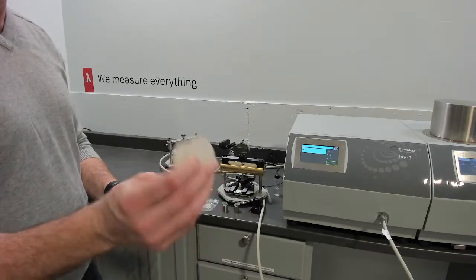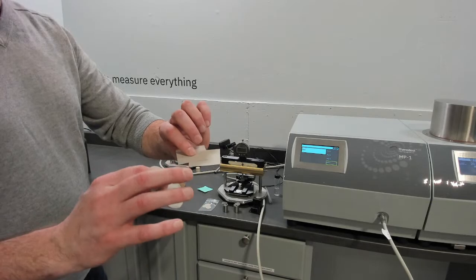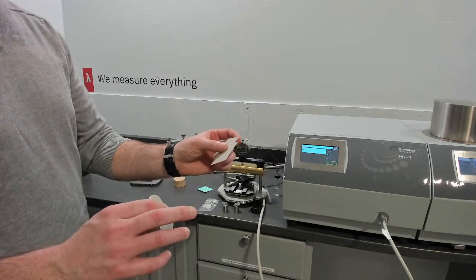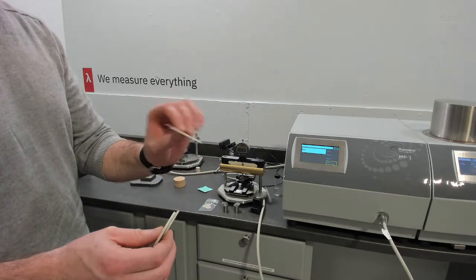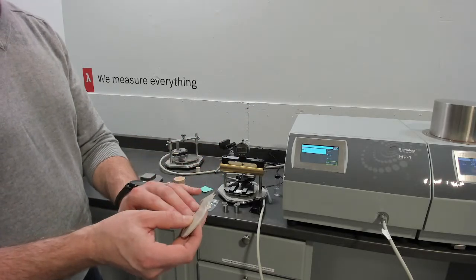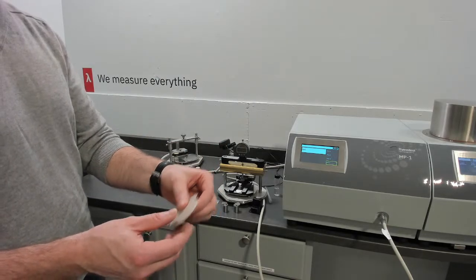So these are roughly a few millimeters thick. These are roughly around 0.3 millimeters thick. We're able to measure this with the TPS slab method with the backing correction that's available on the MP-1. That's again a proprietary extension of the slab method to be able to measure lower conductivity thin polymers with the slab method. So those two can be used on the slab method. Again, looking at configuration and dimensions of sample to extend the method.